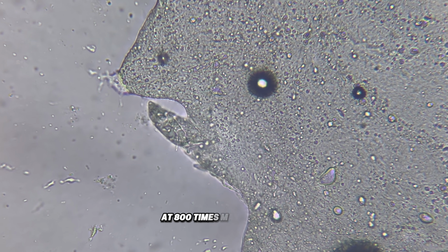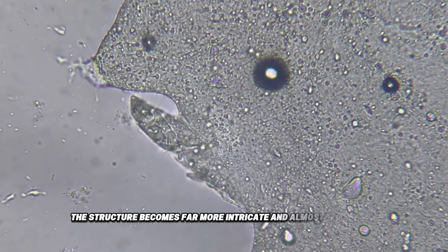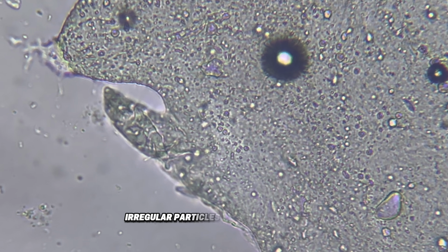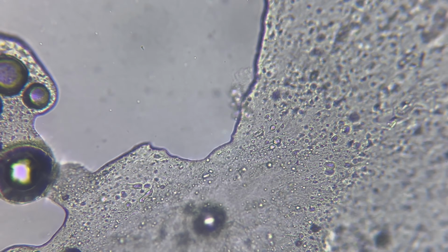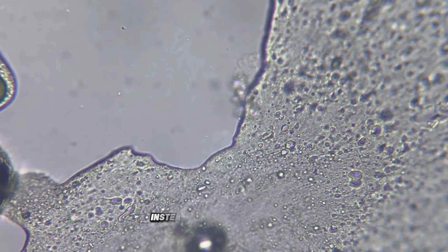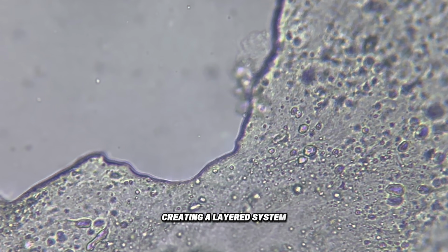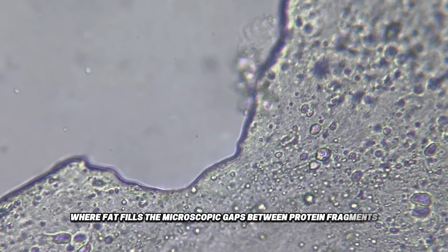At 800 times magnification, the structure becomes far more intricate and almost unfamiliar. The protein matrix now appears as a dense network of tiny, irregular particles, forming a continuous but highly textured background. The fat phase becomes more dynamic and dispersed. Instead of only large droplets, many smaller ones appear throughout the structure, creating a layered system where fat fills the microscopic gaps between protein fragments.